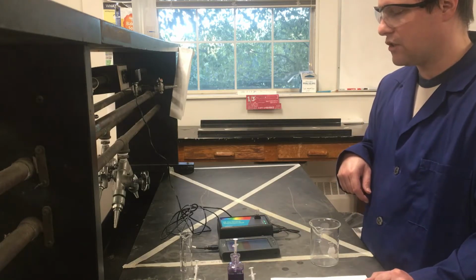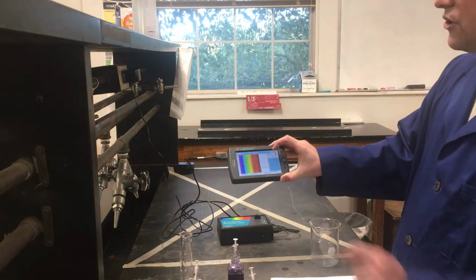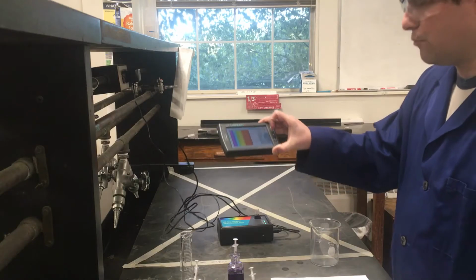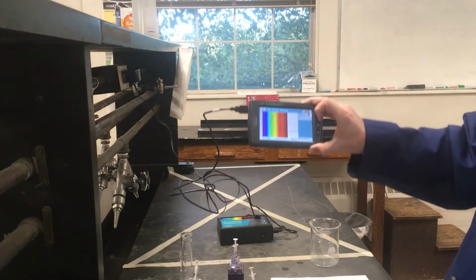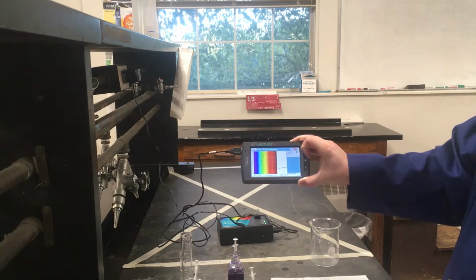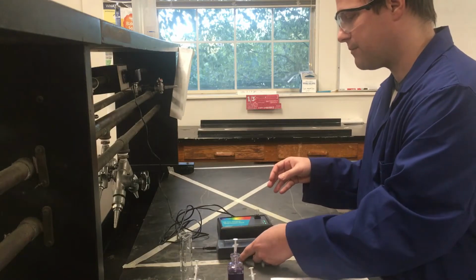And now what it's going to do is it's going to generate this plot. And it looks really colorful here, and I can adjust the wavelengths. I want to look at this, actually went a little bit past the visible spectrum, and I'll move this up a little bit so it can hopefully be seen by our camera a little bit better. But we see a really big peak in here, what looks like kind of the yellow region of our spectrum, which is pretty much what we would expect. And so I'm going to go ahead and stop this.